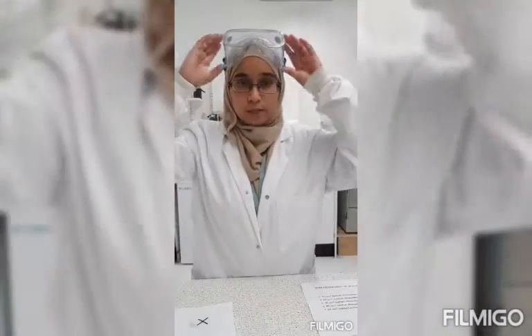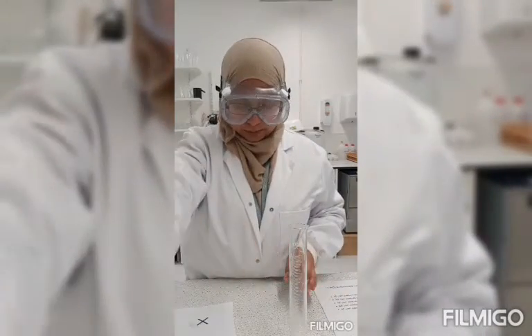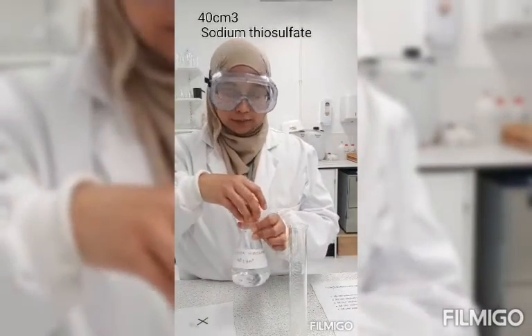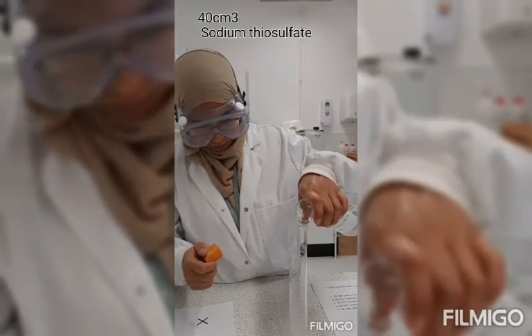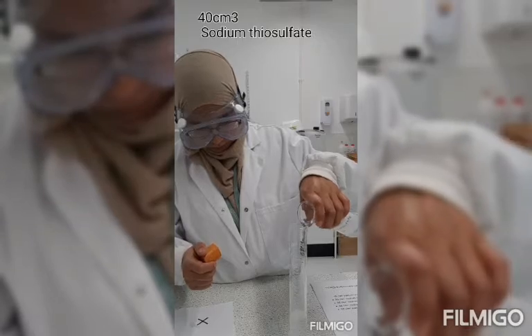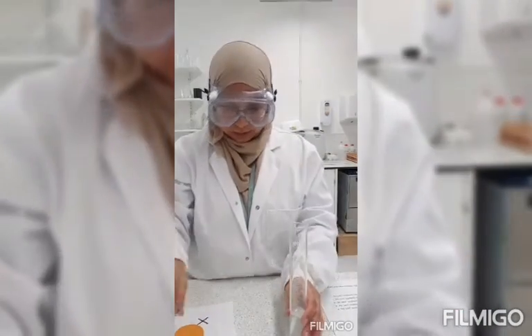First things first, put my goggles on. Using my measuring cylinder, I'm going to measure out 40 centimeter cubes of sodium thiosulfate. Pour that into my flask.